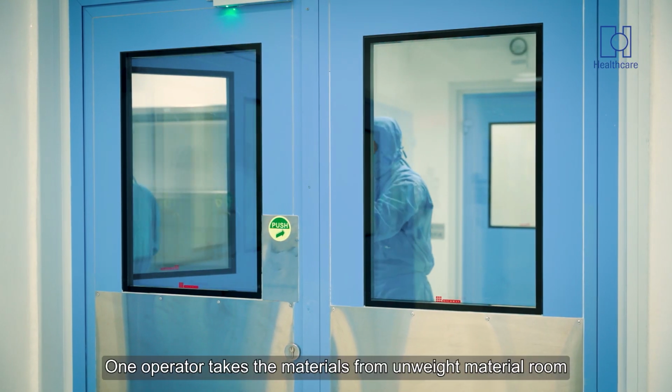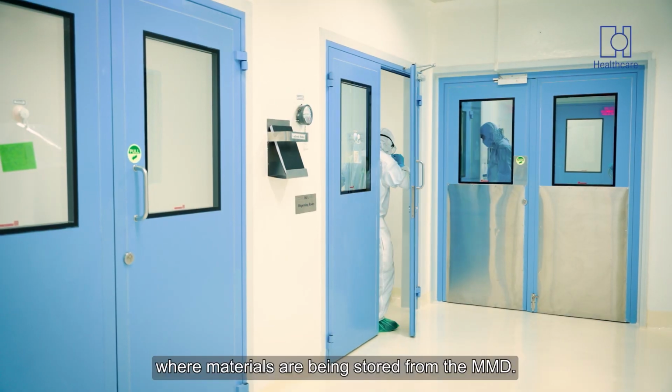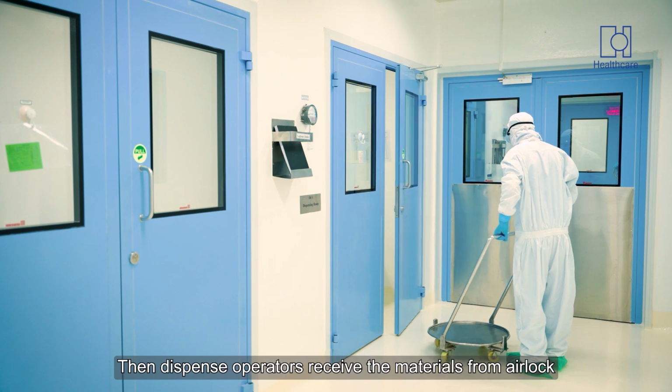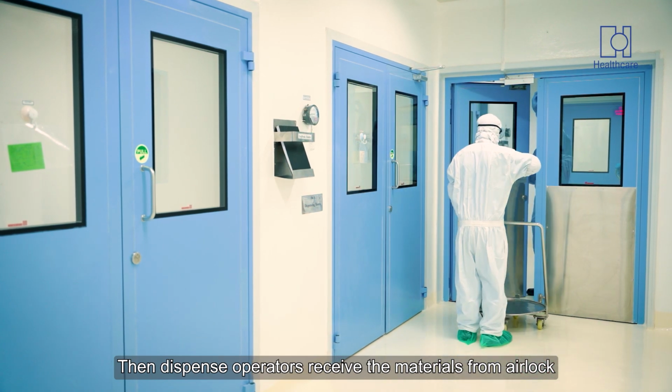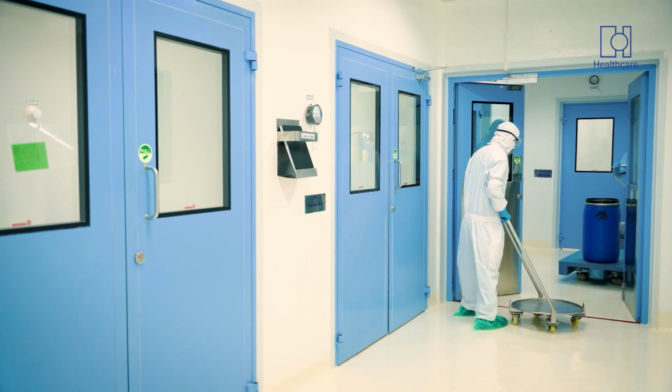One operator takes the material from the unweighed material room where the materials from the MMD are stored. Then the dispensing operator receives the materials from the airlock and takes them into the dispensing room.